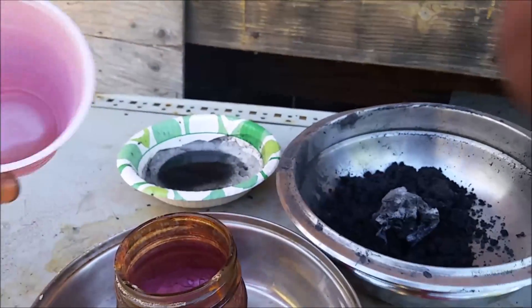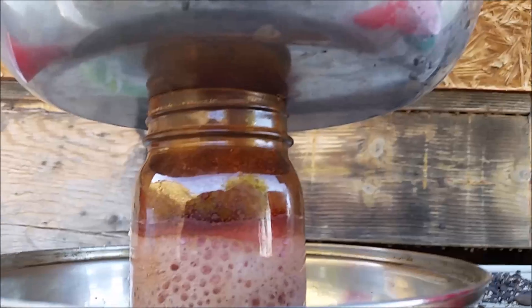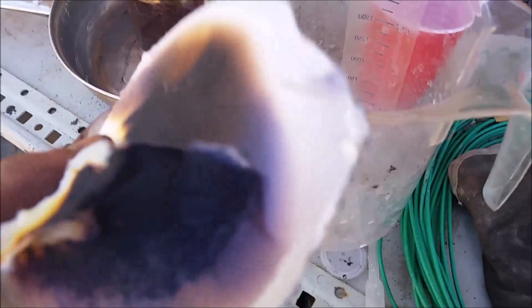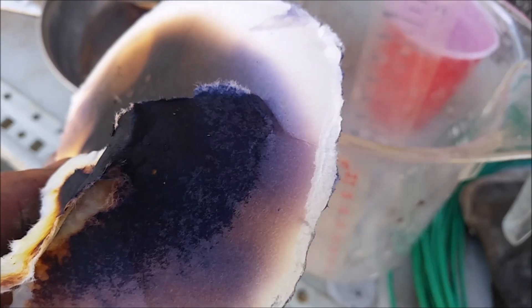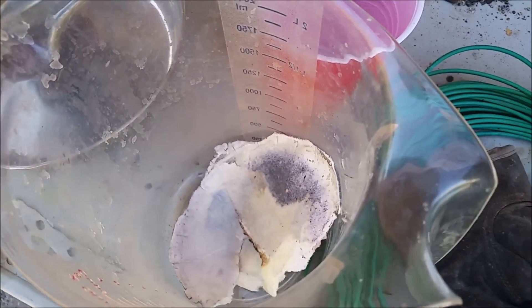Let's go ahead and add some more acid. That's still purple — good. I might be able to make iodine crystals just with that. Look at that, that's iodine — might even be some crystals in there. I'm gonna go ahead and put it in this, get it wet, and add some sodium hydroxide to redissolve the iodine crystals so I'll have a solution with pure iodine in it — that'll be my sodium iodide.